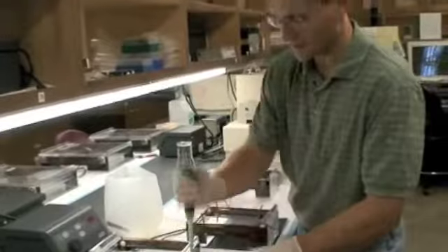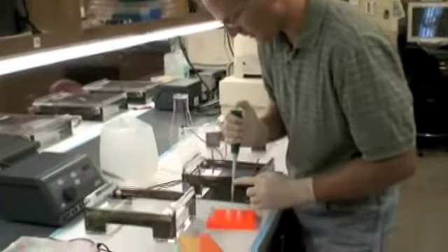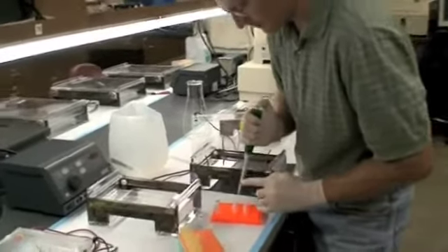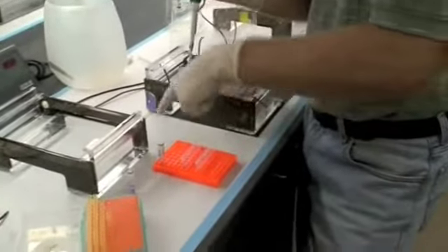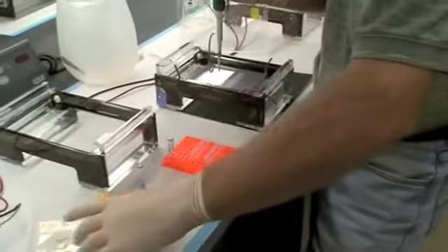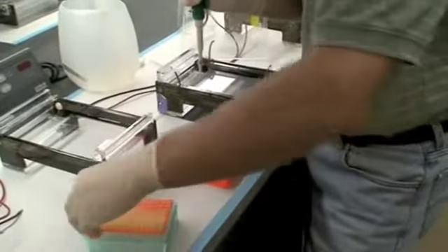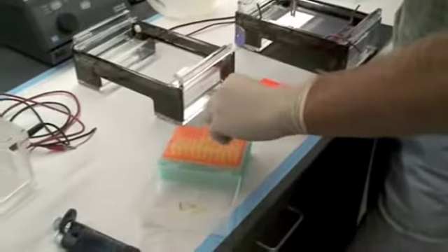So I'm just going down to the first stop of the pipetter. If there happens to be some of my sample left, then I throw it away. Another trick is that this is 96-well plate format, this rack, and I've got eight across.